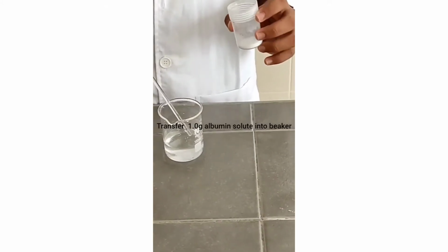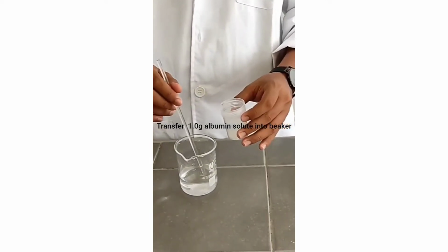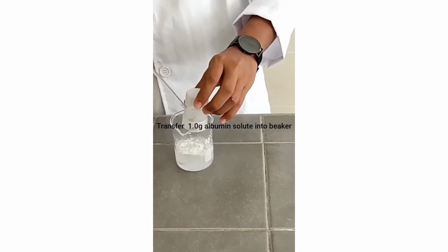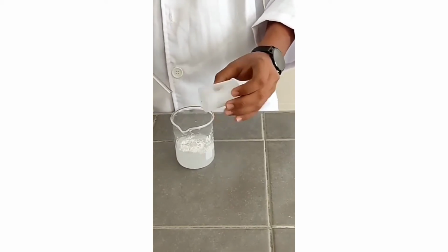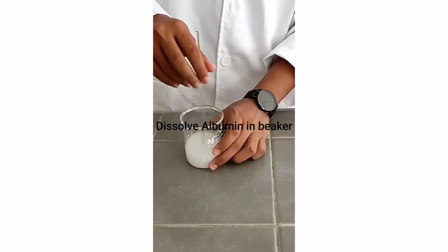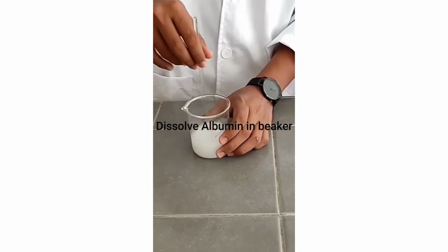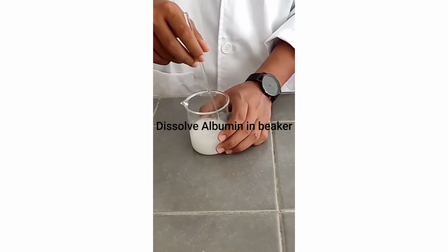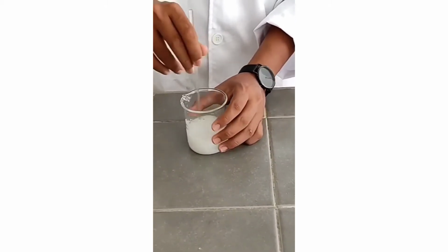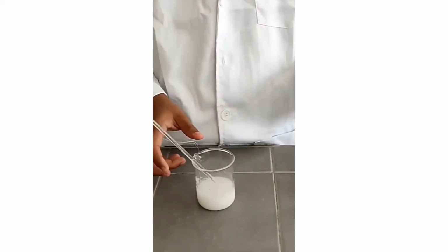Transfer the 1.0 gram of albumin solid into the water beaker. Okay, we must dissolve the 1.0 gram of albumin in the water in the beaker. Make sure the albumin dissolves in the water. Okay, nice.